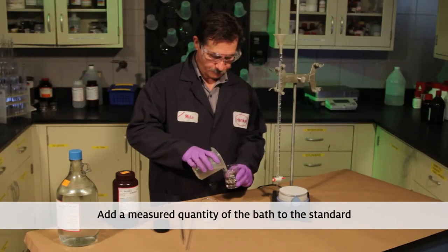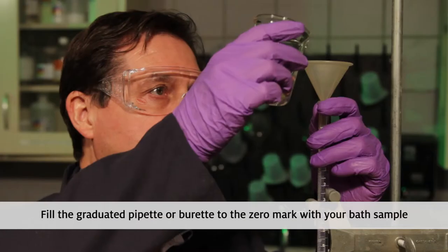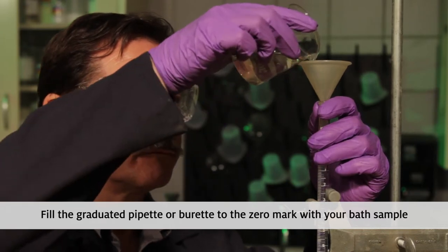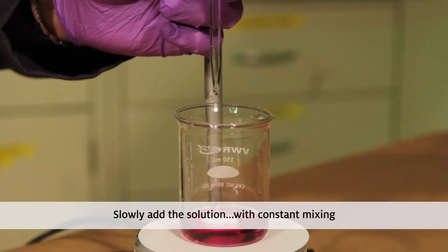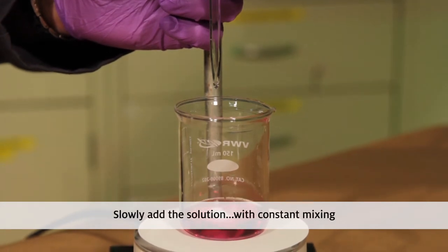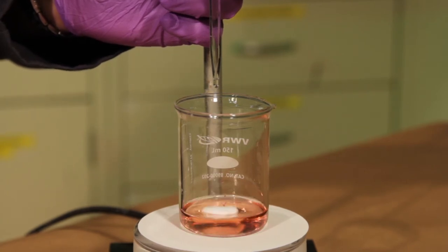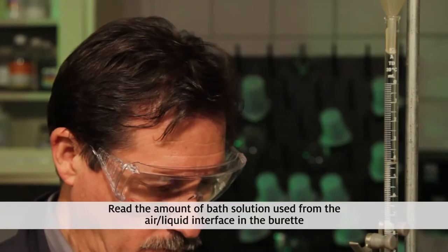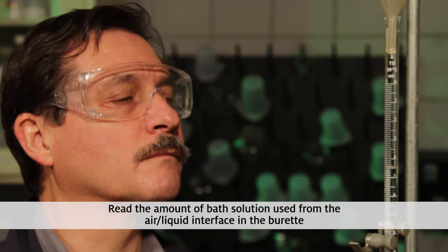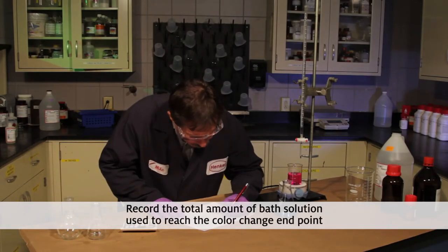With a reverse titration, you add a measured quantity of your bath to the prepared standard. The first step is to fill the graduated pipette or burette to the zero mark with your bath sample. Slowly add the solution from the pipette into your prepared standard with constant mixing. Proceed slowly and watch for the color change indicated on the process bulletin, and stop adding the bath solution when your sample changes to the correct color. Read the amount of bath solution used from the air-liquid interface in the burette, and record the total amount of bath solution used to reach the color change endpoint.